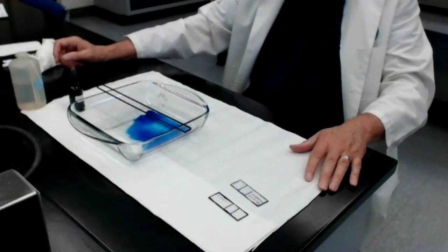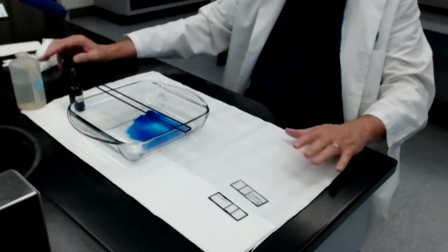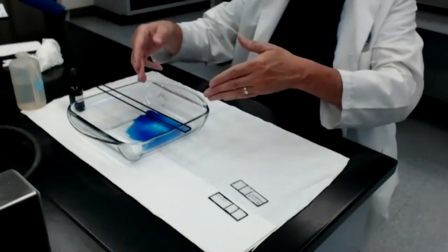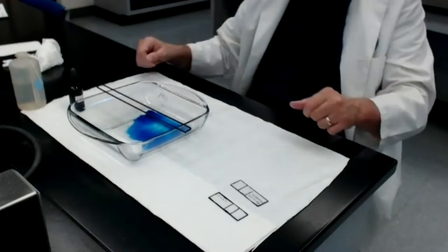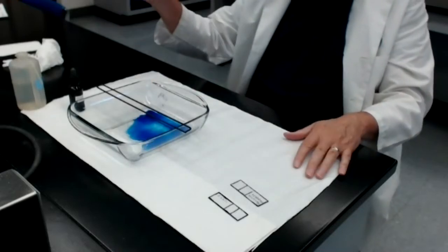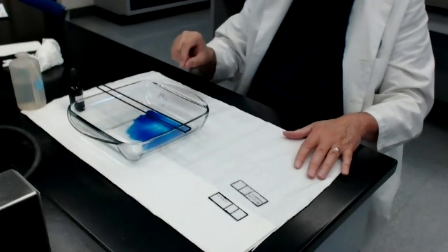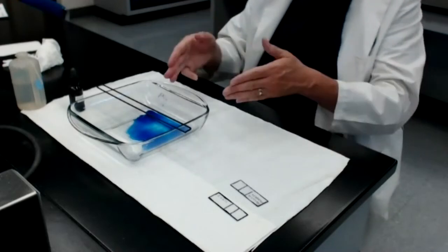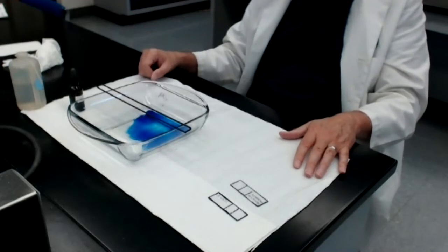Now, a couple things I want to note. Before I started this video, I washed my hands and I disinfected the lab bench. Second thing that's important to know is that you need to properly dispose of this used up staining solution that is sitting at the bottom of the staining dish. We have a special bucket that is designated for this sort of waste. So when I'm done shooting this video, I'm going to empty the staining dish into that staining bucket. Then of course I'll wash out the dish.